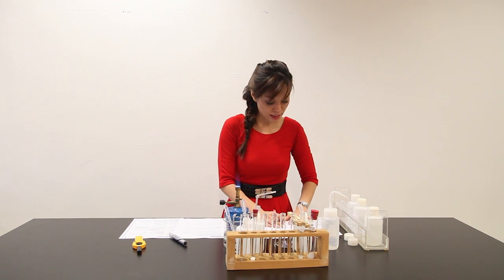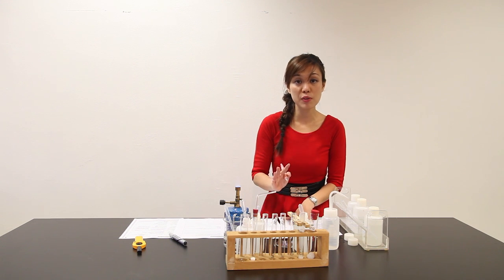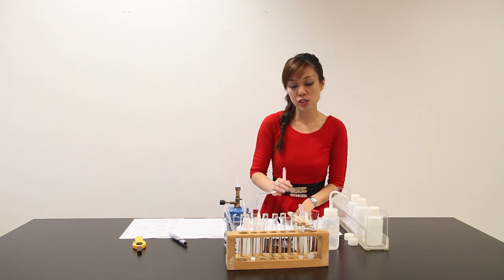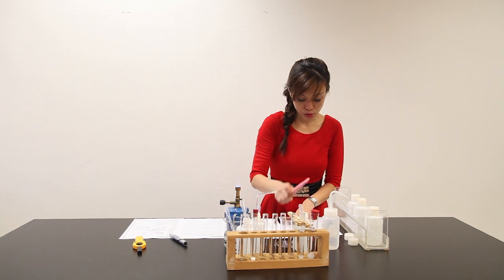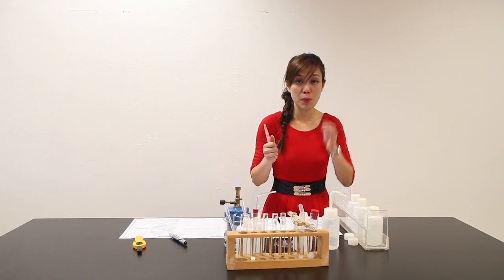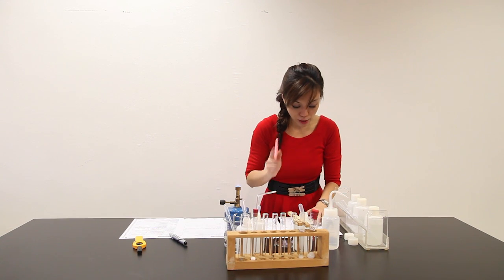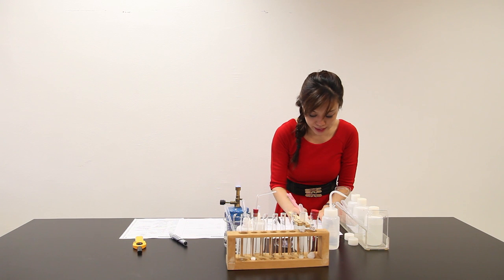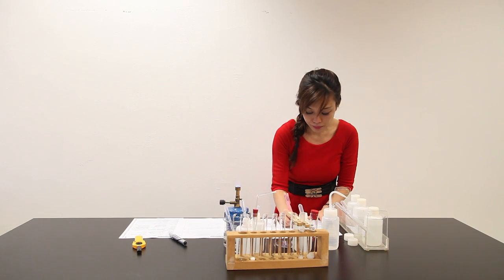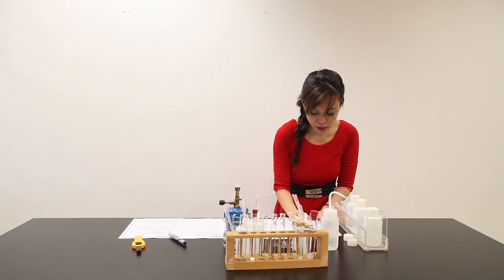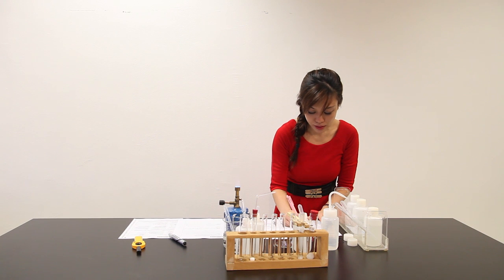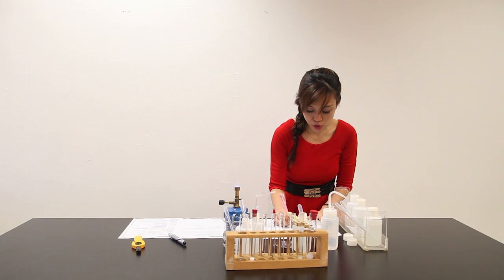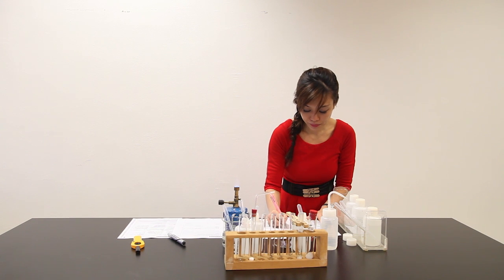We have finished this part. This is a four marks question: two observations of the solid and two observations to the litmus paper and glowing splint. Not forgetting, upon further heating, solid Q turned to a pale yellow solid.